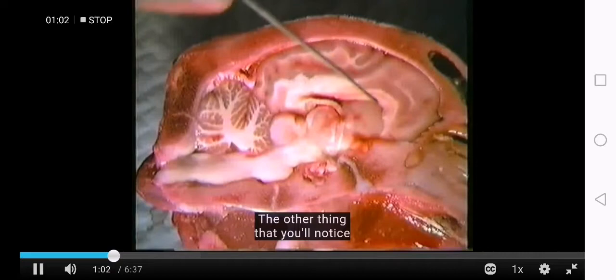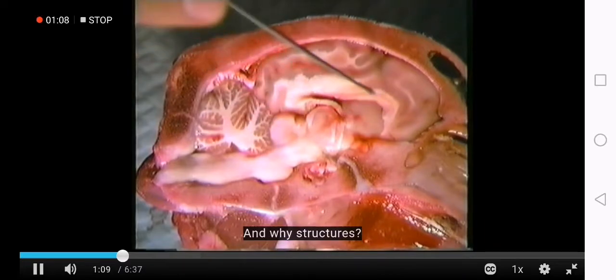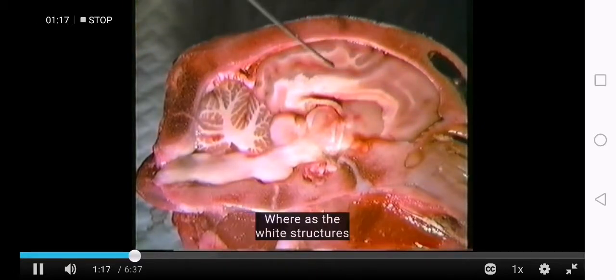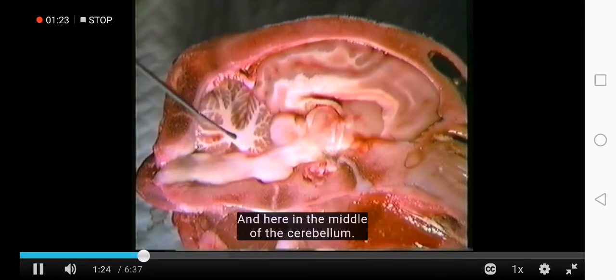The other thing that you'll notice here is that there are grey structures and white structures. The grey structures tend to be on the outside of the brain, whereas the white structures tend to be in the middle of the brain, and here in the middle of the cerebellum.